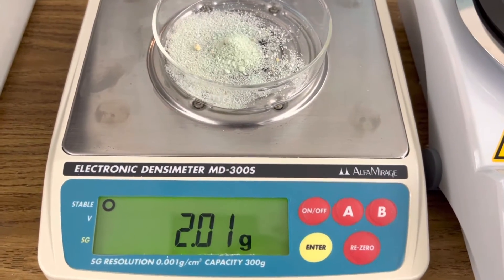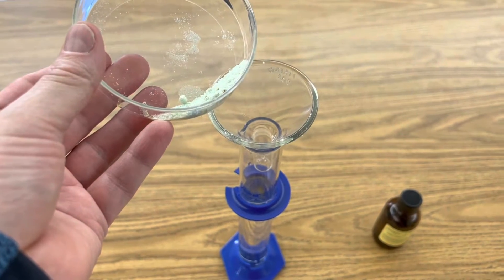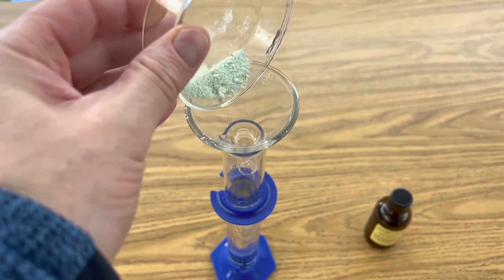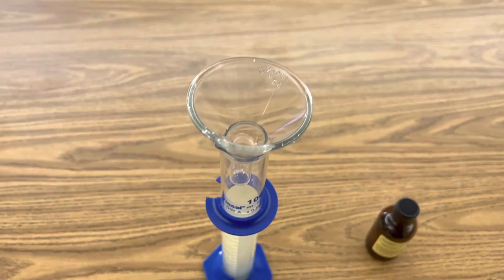Begin by measuring out two grams of ferrous sulfate. Next, add your two grams of ferrous sulfate to a hundred milliliters of distilled water and stir your solution until it's aqueous.